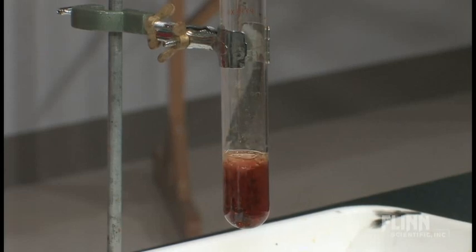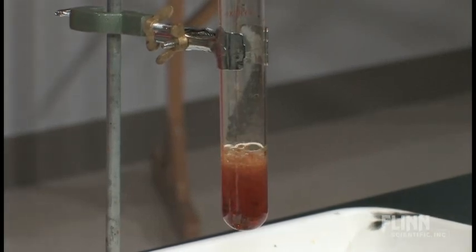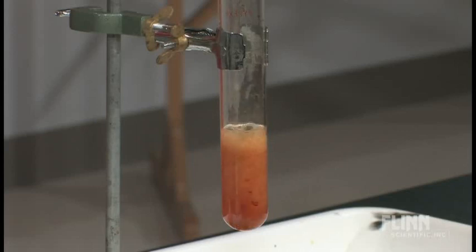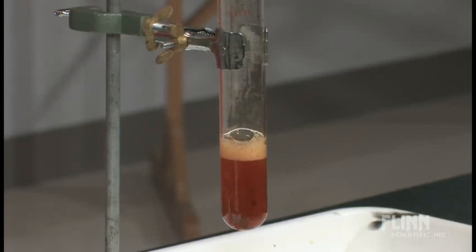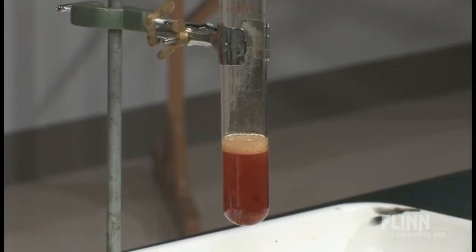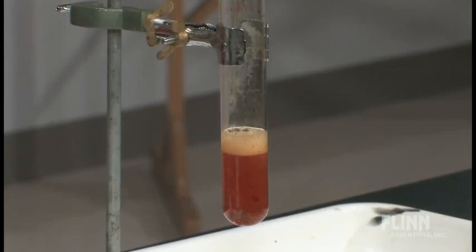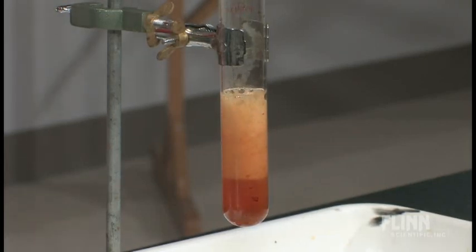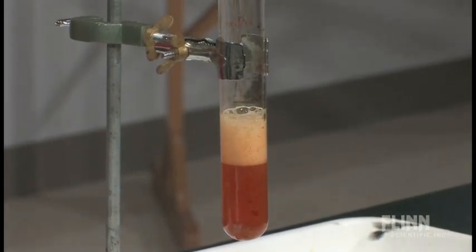You can start to see some of the bubbling. I'll wait until it gets going a little bit vigorously. And then if you put in the sodium phosphate, the bubbling still happens but then it slows down and it's not happening at nearly the rate. And I'll add a little bit more inhibitor because I'm not sure how much of the iron chloride is left in there.